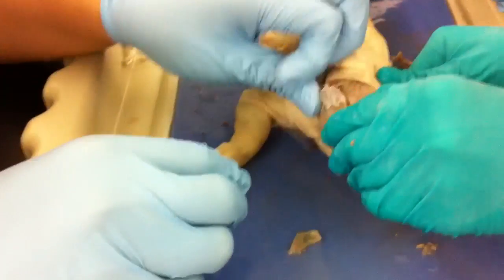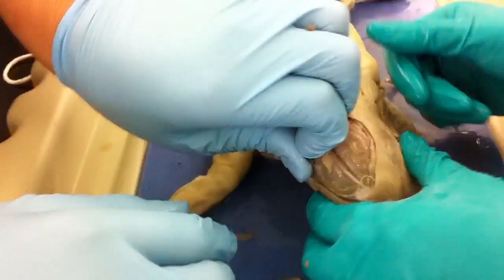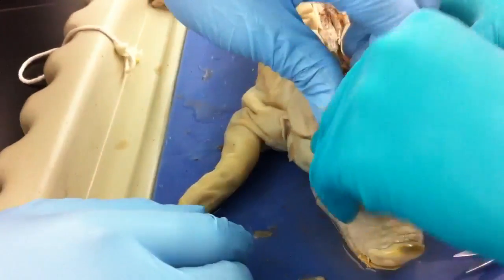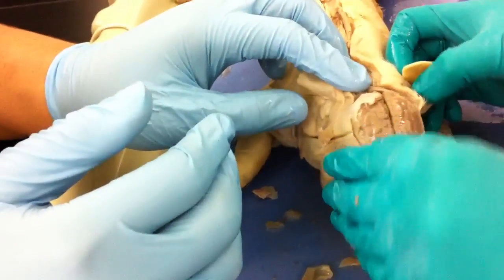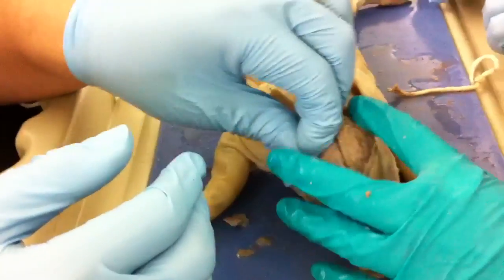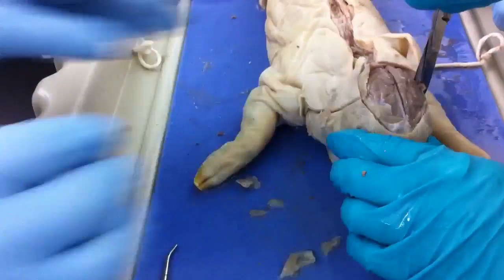Ours is tiny. What does yours look like? Oh, there's a thing. This is like wrong. I'm thinking about it now. I'm trying to open up a pig's brain. That's how low we are, man. I'm breaking a skull. That's what we're trying to do right now — we're trying to break a pig's skull.